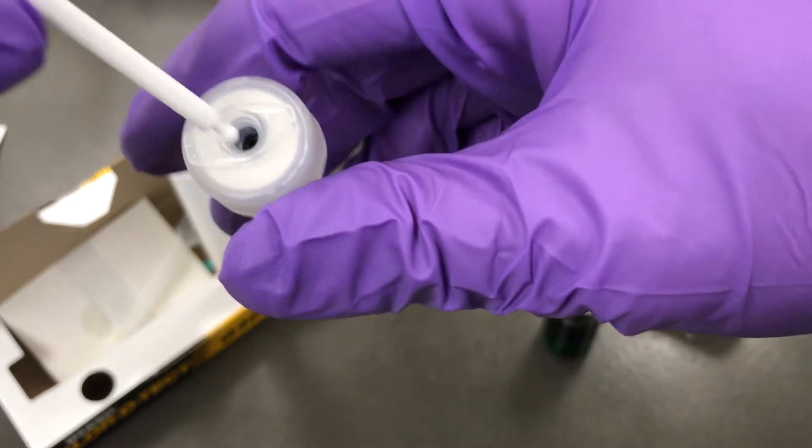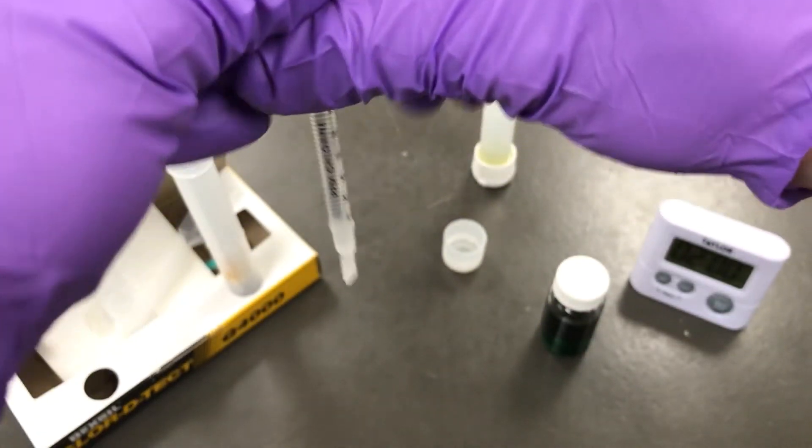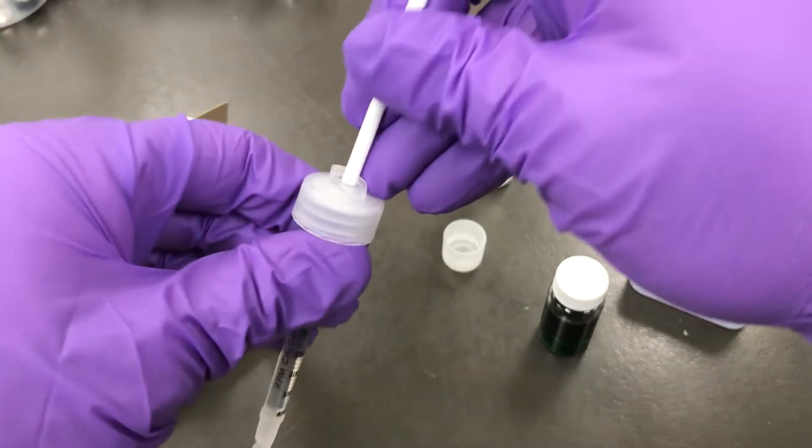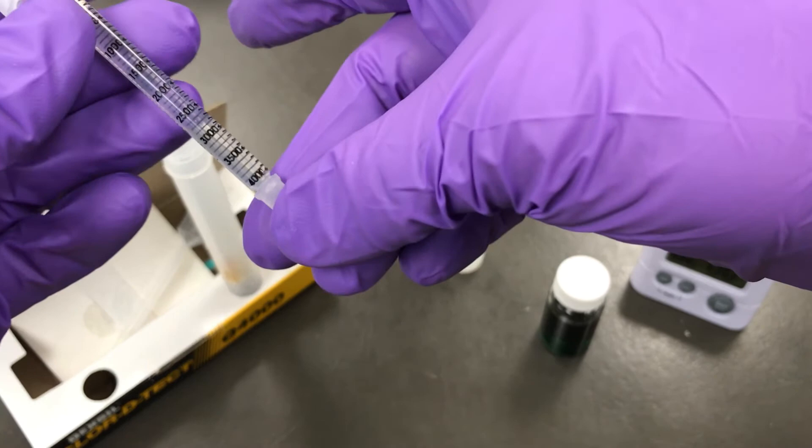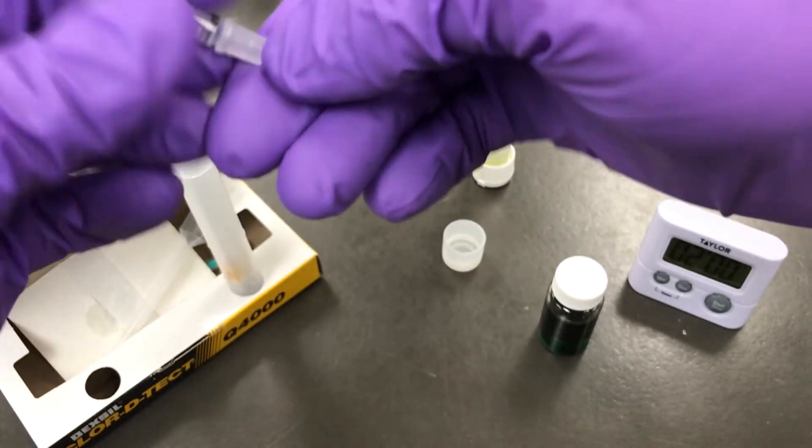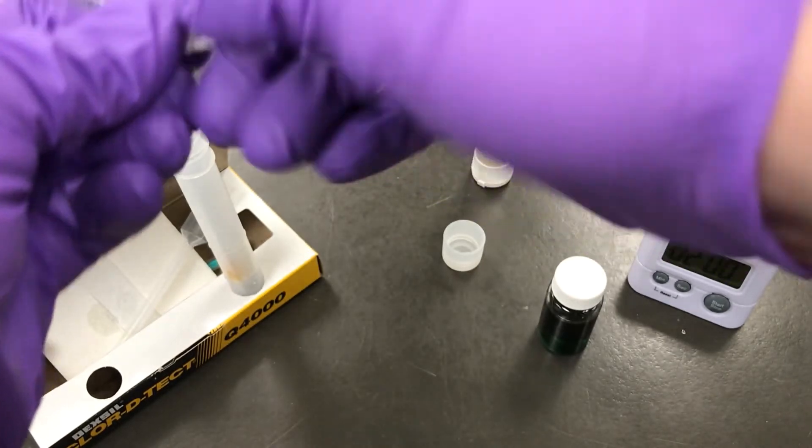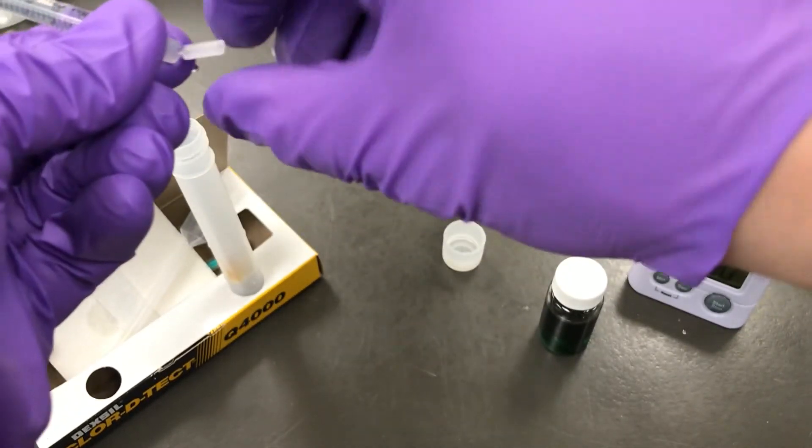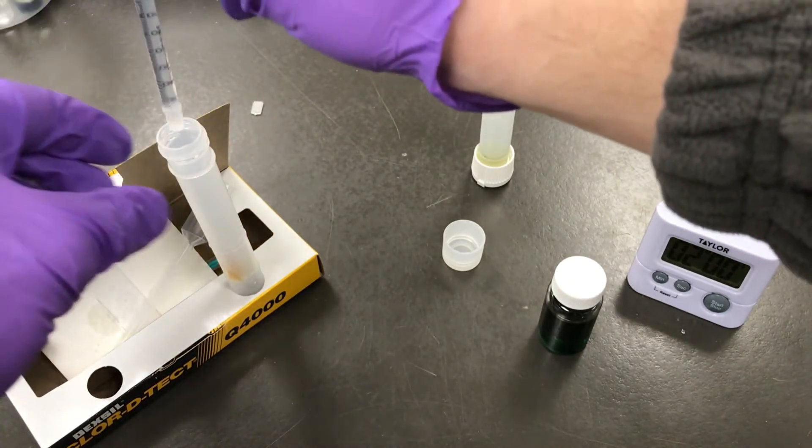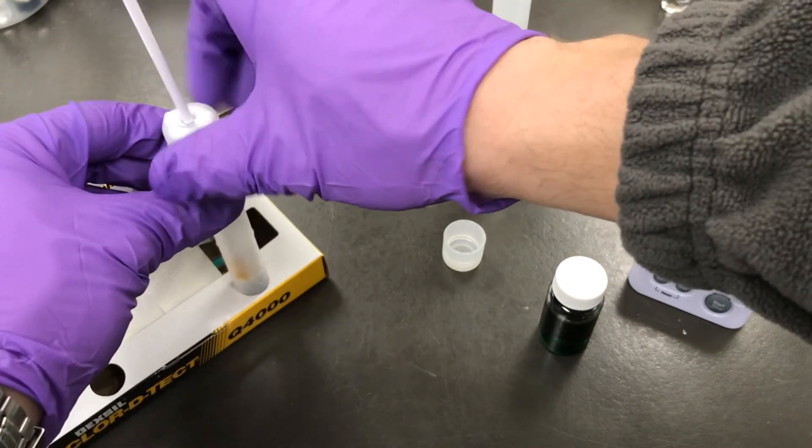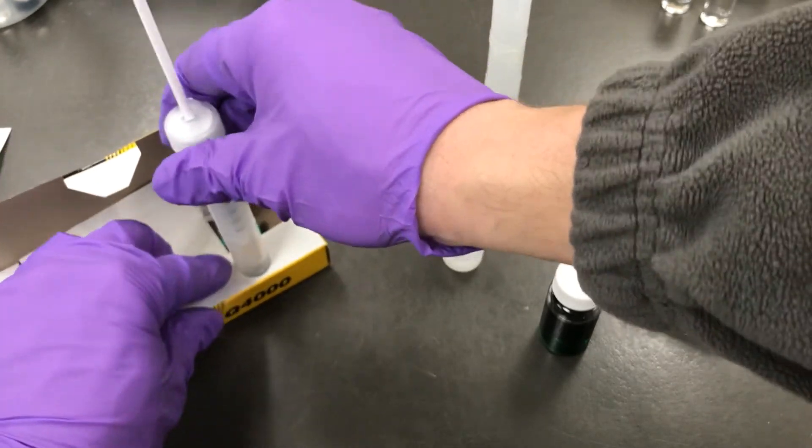Next, take the white plunger. You'll notice the ball end will fit into the back of the burette. There's a rubber gasket with a hole and you should feel this engage and click into place. Next, you can twist the plastic tab off the tip of the burette. The titration burette will now screw into the top of test tube 2.